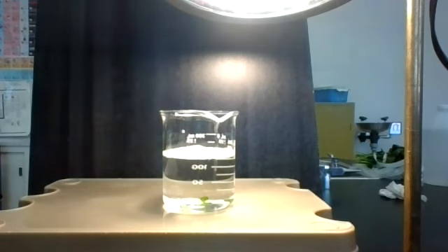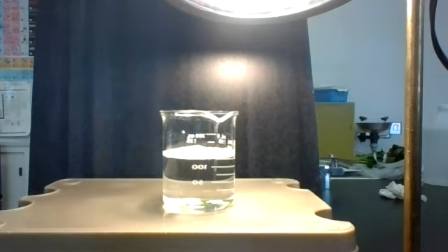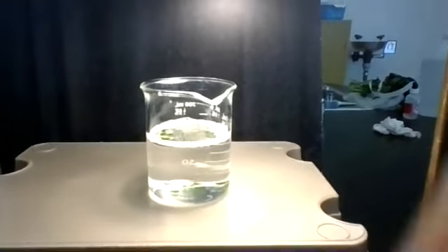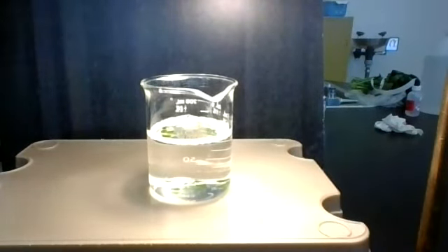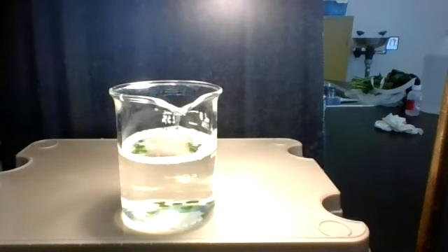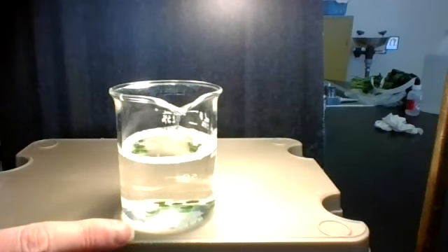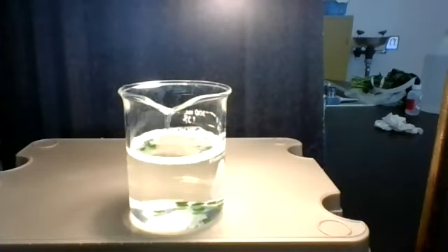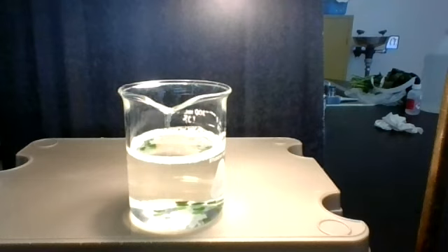You can see them at the bottom. Let's play around with this a little bit — let's see if we can get this a little bit easier for you to see. It's not too bad. You might see them all at the bottom, and they kind of reflect at the top up here, but they're all down here at the bottom. There are 10 of them.